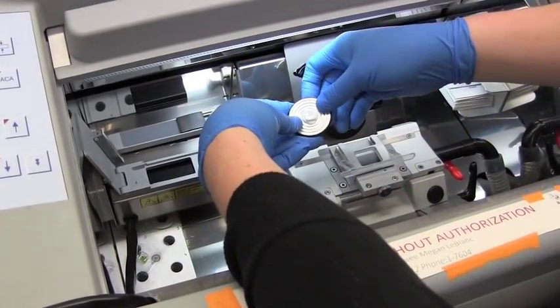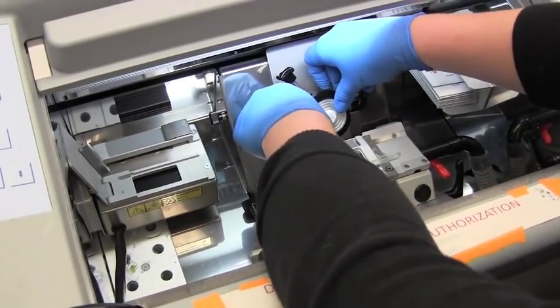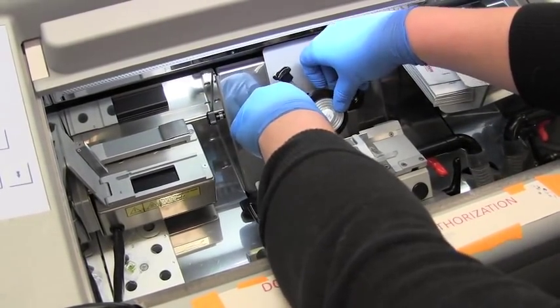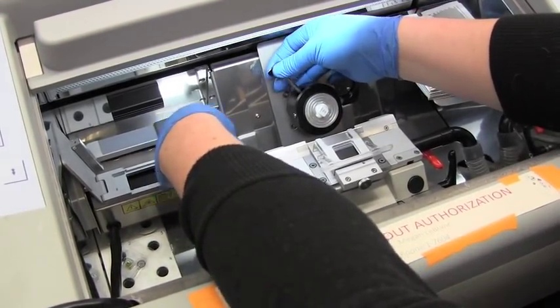So once our sample's been frozen solid to the chuck, we're going to mount it here and make sure it's seated quite deeply. And it's going to be tightened down with this first screw.